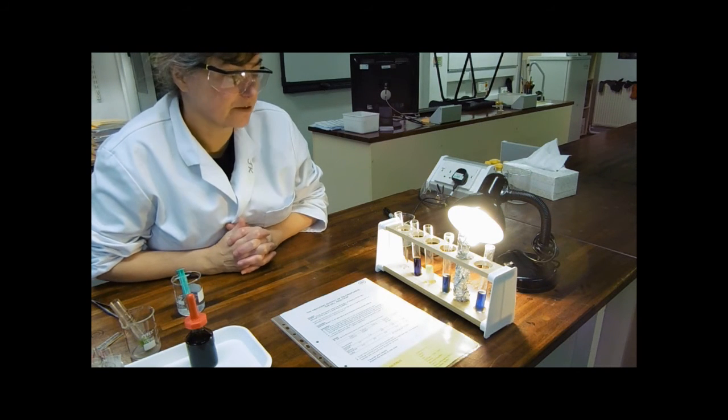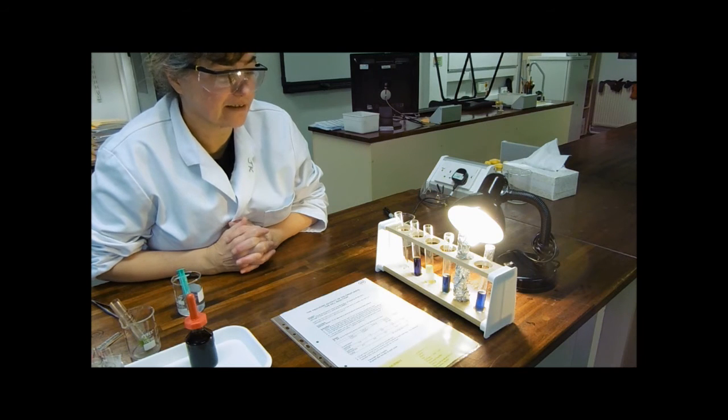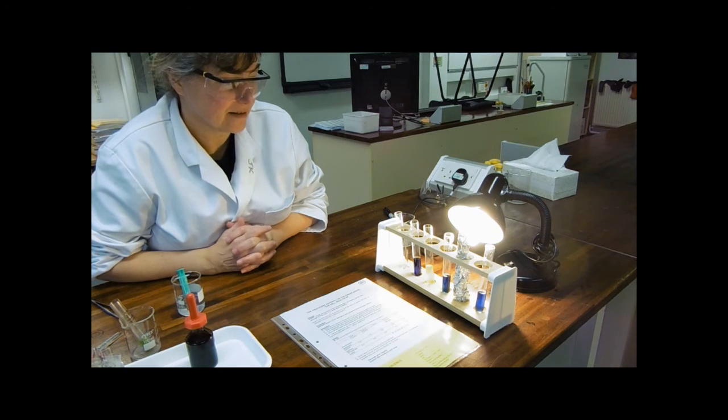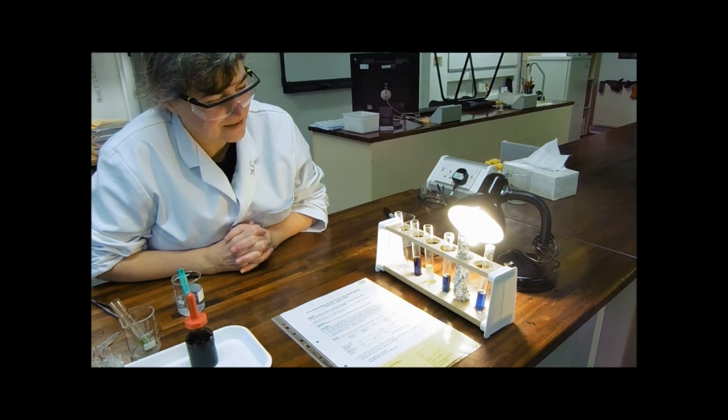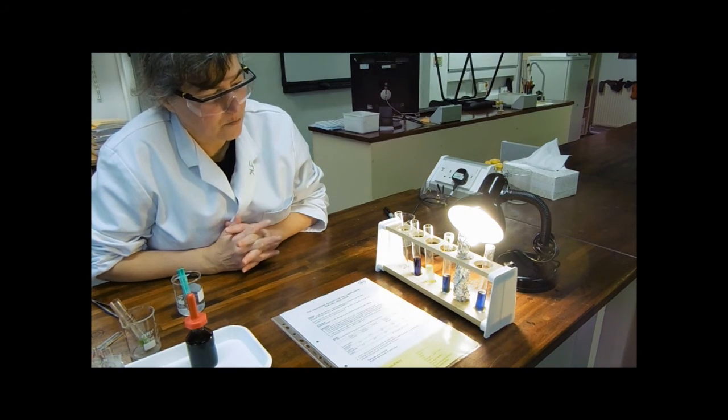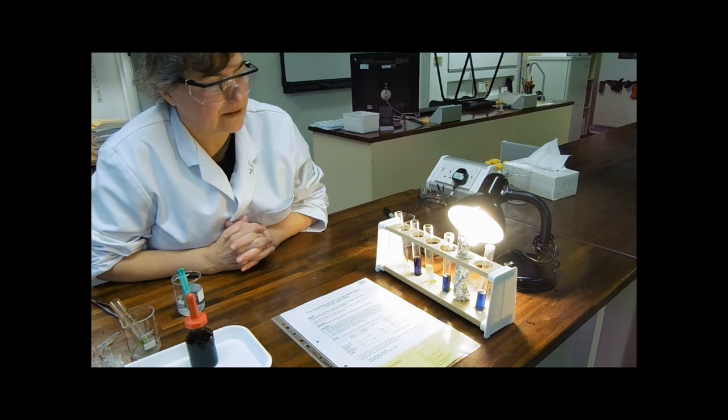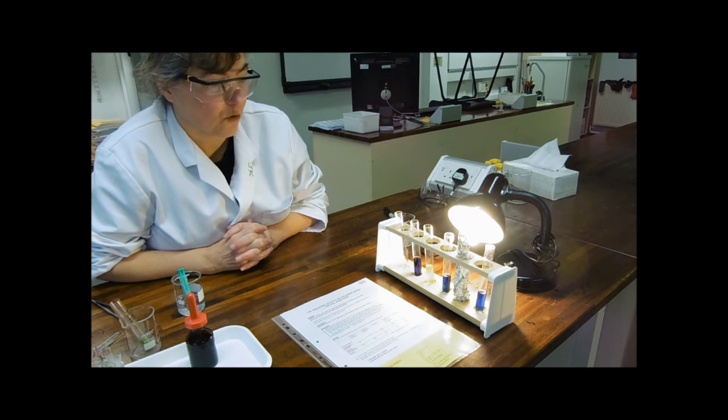I don't know what Dr. Selwell wants to do now because potentially there's mileage in stopping it because again, we're watching paint dry, we're waiting for photosynthesis to happen. So we'll come back when that's completed and I'll show you what's inside tube 4, which will be exciting.